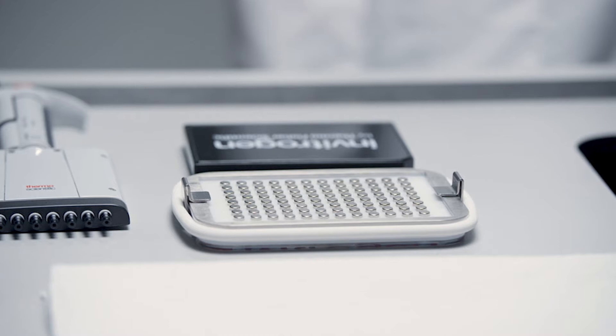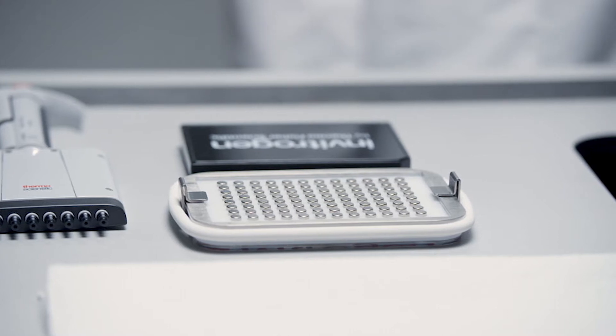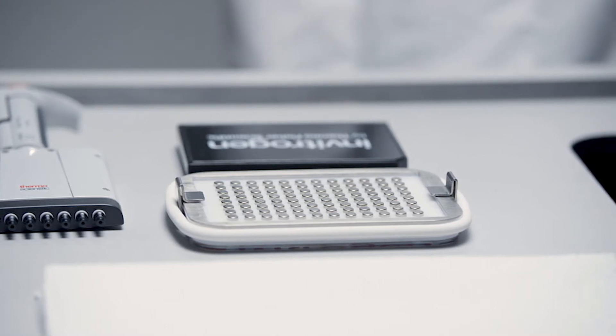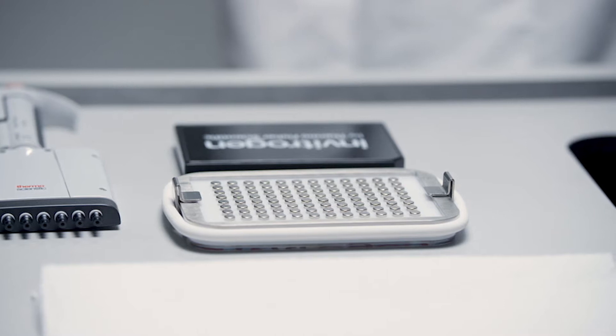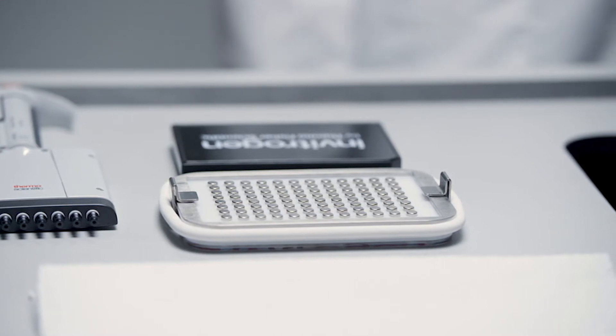The plates from the Invitrogen Quantigene Plex assays are not shown here. Refer to the Quantigene Plex Assay User Guide for the exact details on the washing procedure.